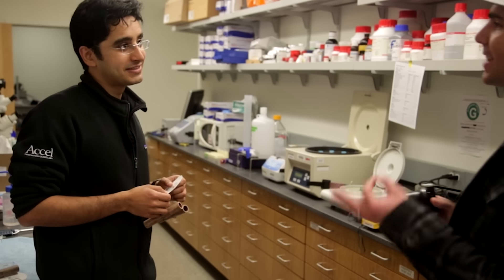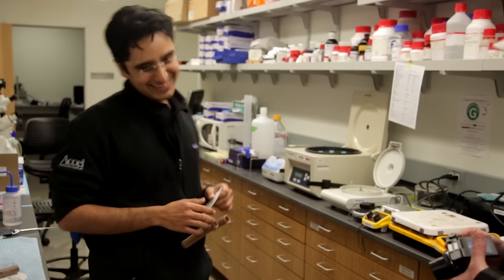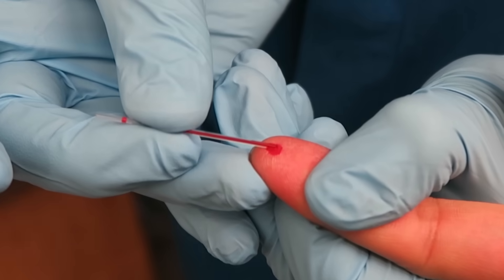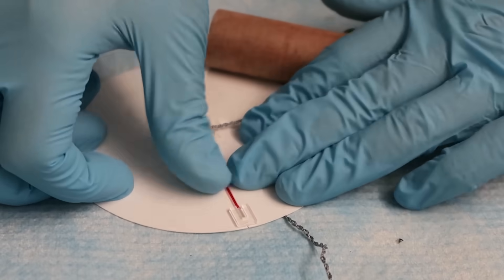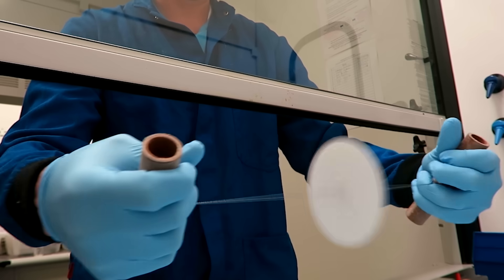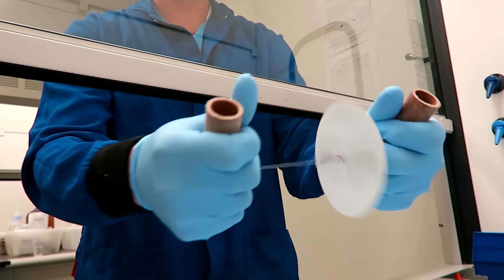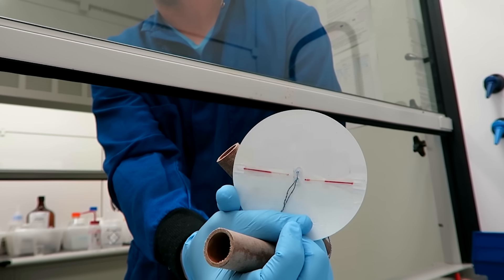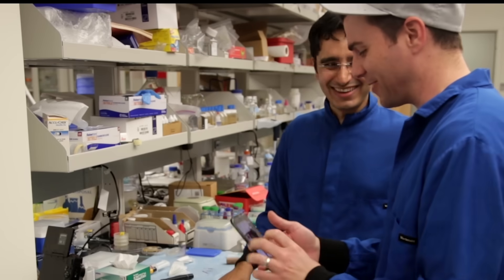Let's recreate that moment. We're going to take some blood and spin it. After spinning only for 10 seconds at 20,000 RPM, you can see my blood was already separating. This is my own blood — I've never seen my blood at this level before. That is crazy. So each one of those is a blood cell?